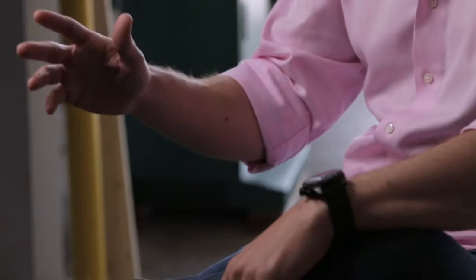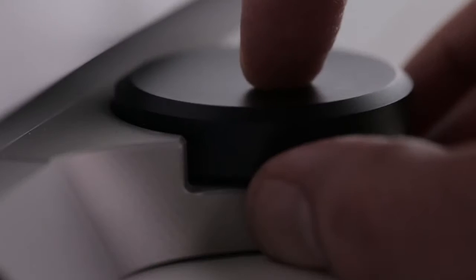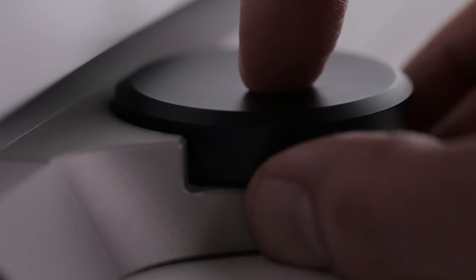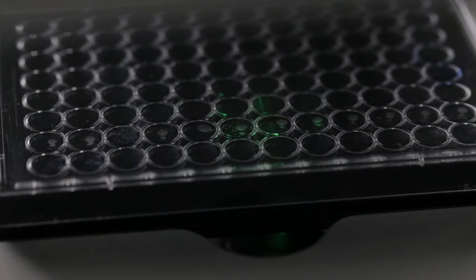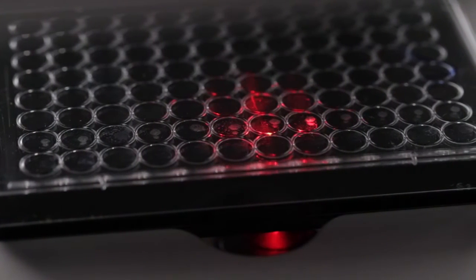Having everything driven through an iPad is just a lot more efficient space-wise. Because the Revolve system is so versatile, you know you're going to be doing tissue culture, you know you're going to need fluorescence, and occasionally you're going to want some publication-quality images. The Revolve system can do all of that in a compact and cost-effective format.